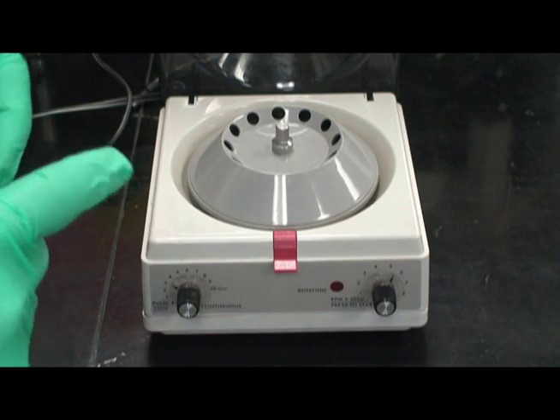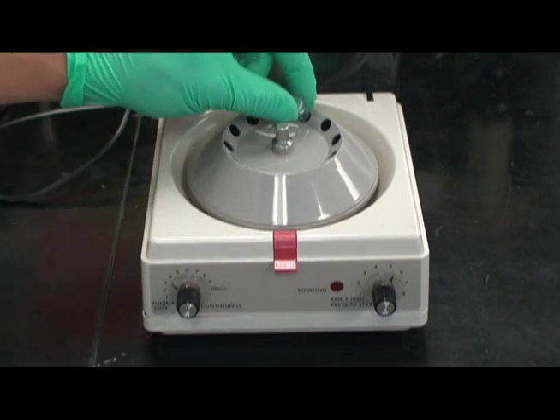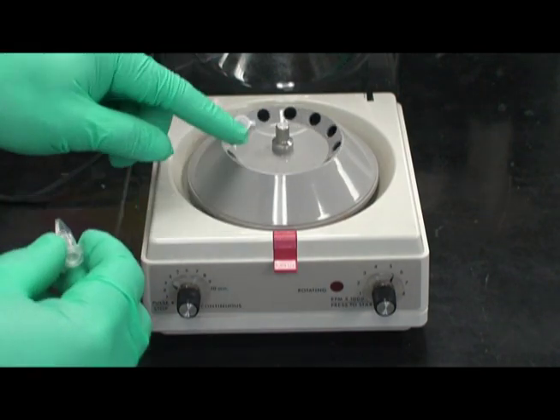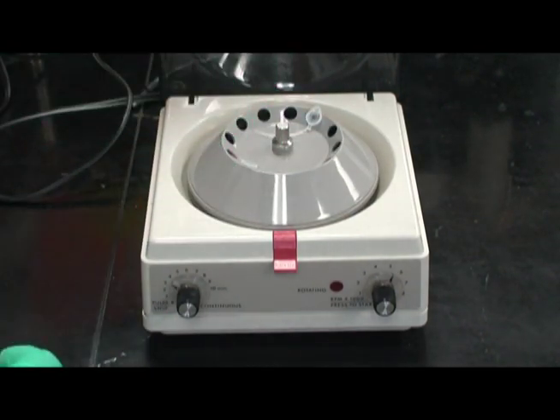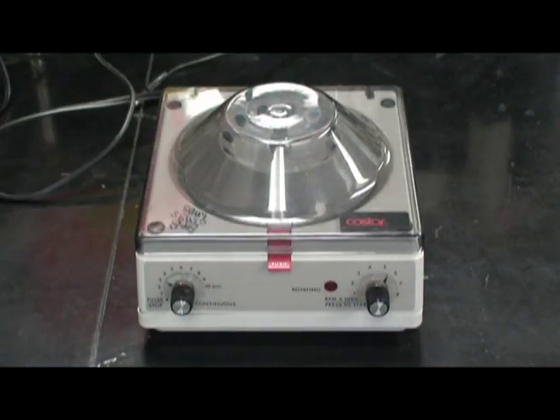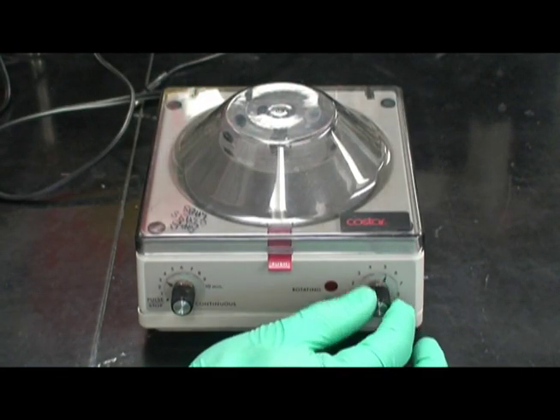Once again, it is important to counterbalance the tubes. Once complete, close the lid and press the speed button to start.